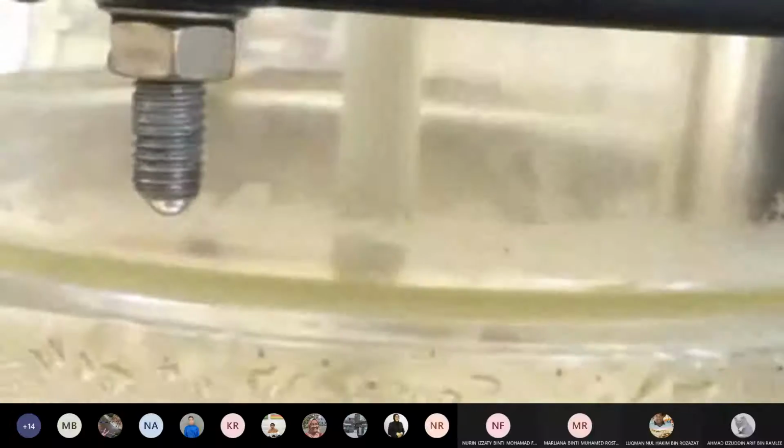So you can see the reactant flows from the top, then goes inside, like this. If you realize, inside is your reactant. So I am going to put the reactant in, actually. Okay.